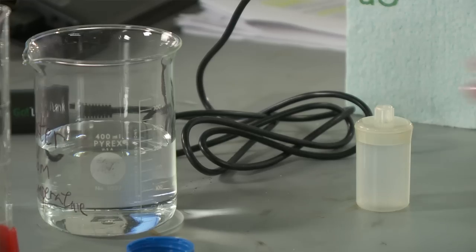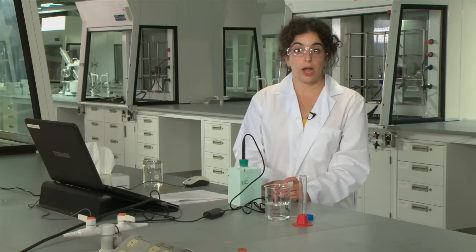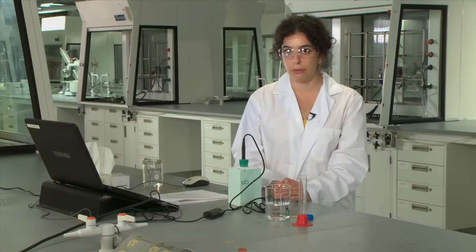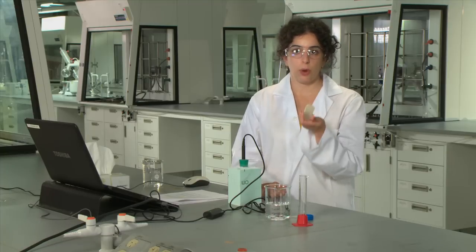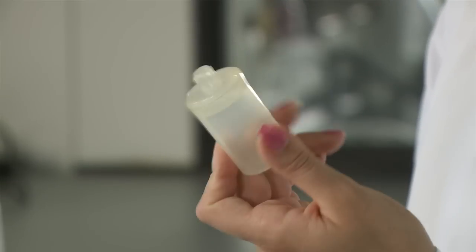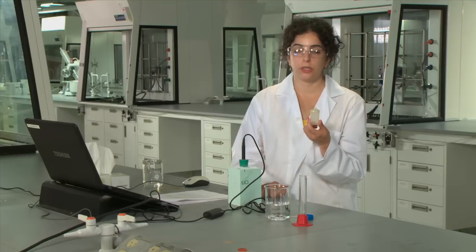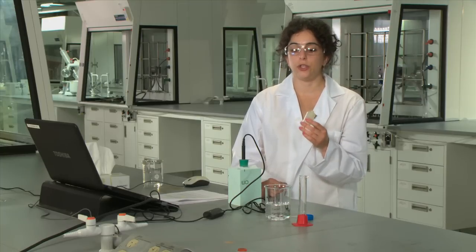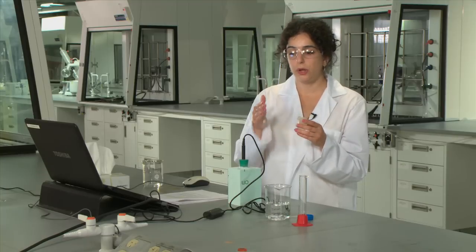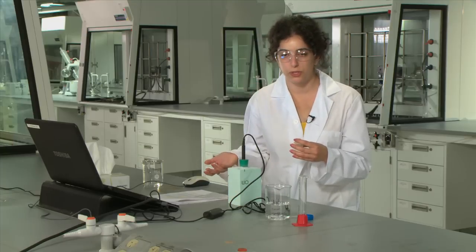You're then going to obtain some salt. You're working with two salts in this experiment: one is the sodium acetate trihydrate and anhydrous sodium acetate is the other salt. You're going to weigh it out using a weighing bottle and an analytical balance and your first measurement will be one and a half grams of salt. It doesn't matter which salt you start with as long as you continue the remaining measurements for that salt before you switch over to the other salt.